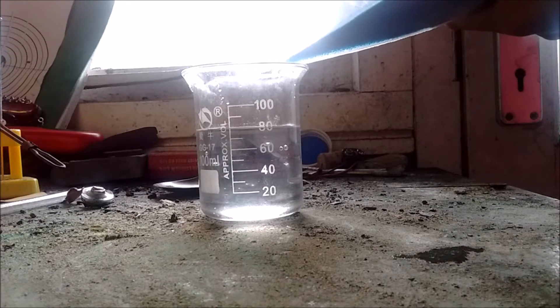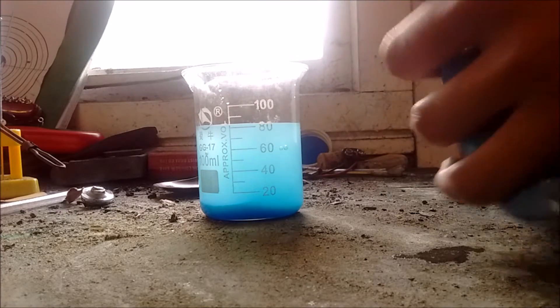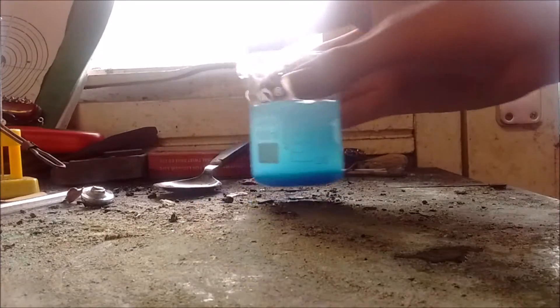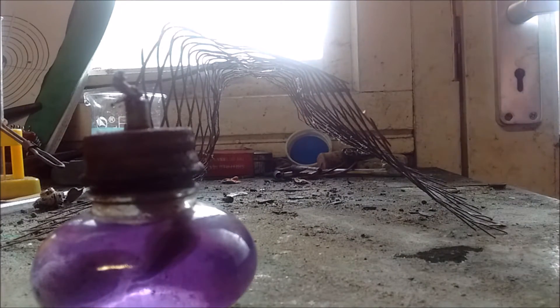Put some of that in the water. Quantities are for people who care about knowing how concentrated their stuff is. Since I'm going to concentrate it anyway, I don't care. Next step: you want to start gently heating your copper sulfate. The bodge runs through me — I'll be using a burner that runs off methylated spirits. You can get it at Trangia and other camping equipment stores. It doesn't particularly matter what you're using to heat it, as long as it heats the thing you're wanting to heat.